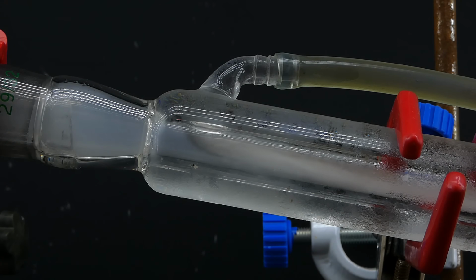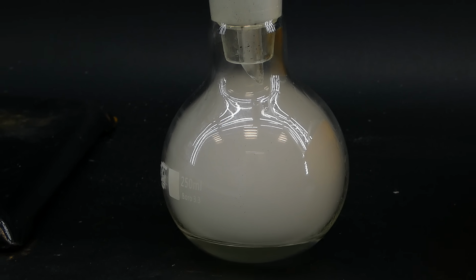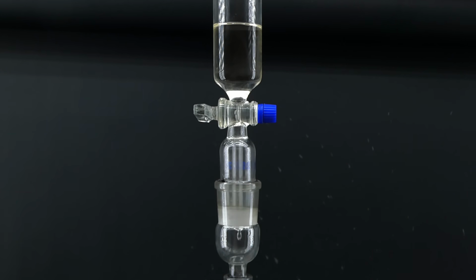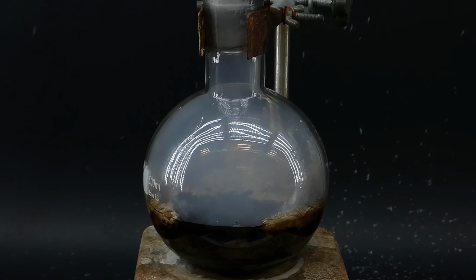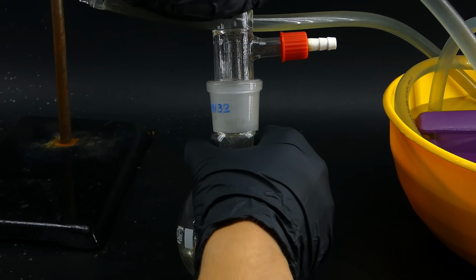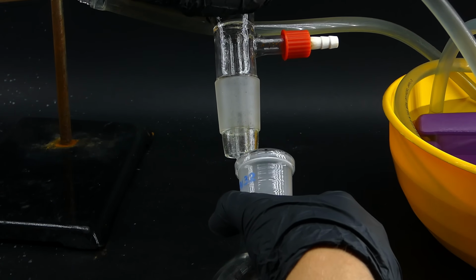The vapor also covers the receiving flask, which makes it really difficult to see what's going on inside. Anyway, I ended up not adding all of the sulfuric acid since the mixture in the boiling flask looked like it didn't need more. It became very black, and with this fog on top, it looked really interesting. Once no more acetic acid was coming over, I stopped the distillation and collected my product.